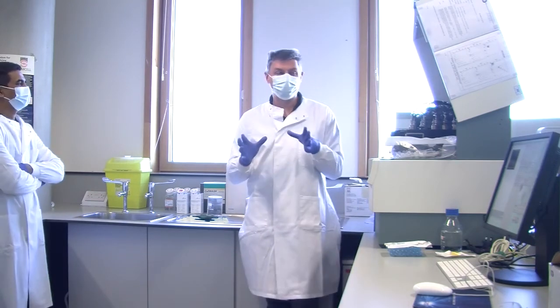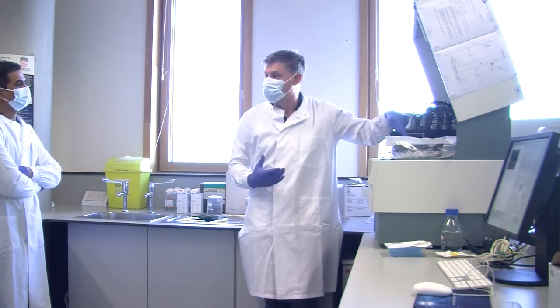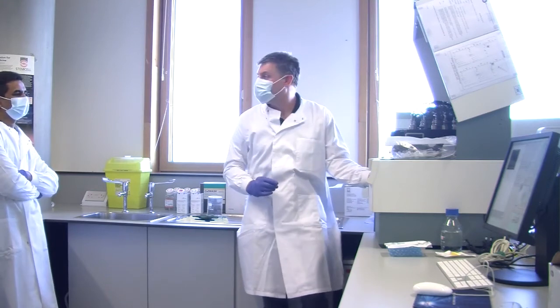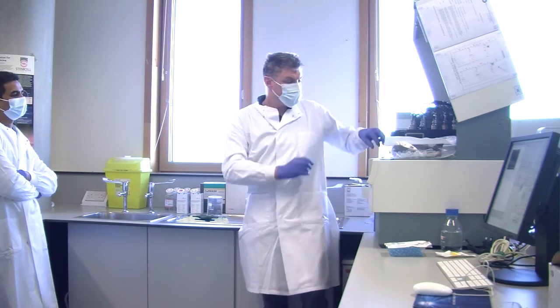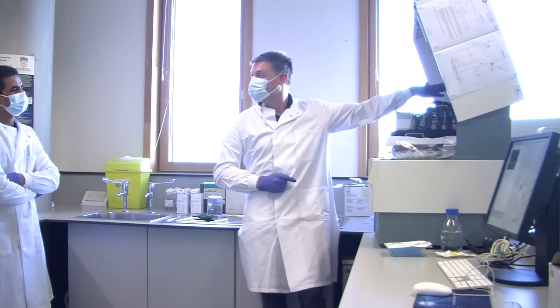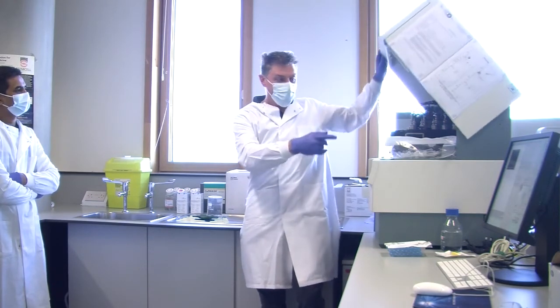Now, it isn't cytometry, but it's related to it. It's a good way of remembering the difference between forward and side scattering. If the particle is bigger than the wavelength, forward scatters. If it's smaller, side scatters. And so that is all set up to run these cells at hundreds of cells per second. So hundreds of cells per second are fed up from the tube, through the laser, through to the waste. That data is all taken off, processed by these rather, these days, primitive electronics. Nowadays this will be a computer chip rather than all of these big circuit boards, but it works. And that data is sent to the computer.